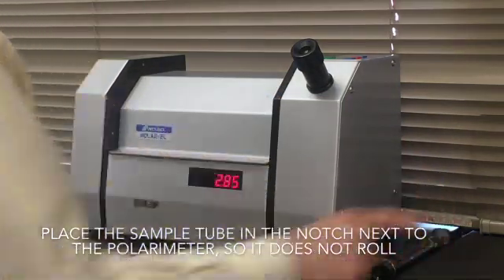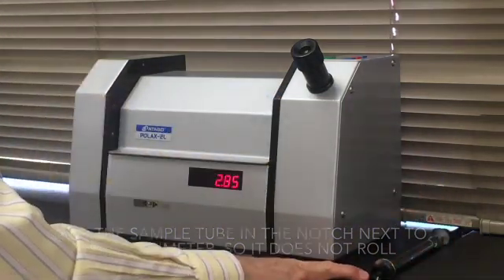First, I want to make sure my sample can't roll away. There's a convenient notch in the desk where you can leave it.